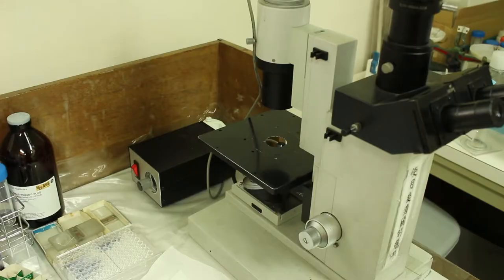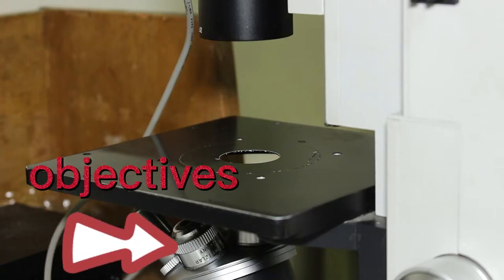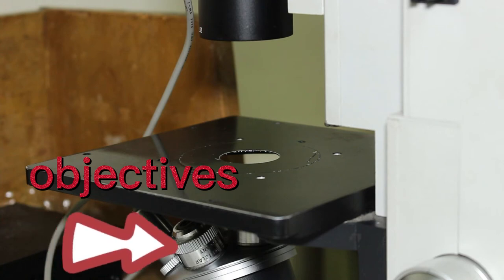The reason why I can use a chamber slide on this is because I'm using an inverted microscope, which has the objectives at the bottom facing up, rather than a normal microscope where the objectives are at the top facing down.